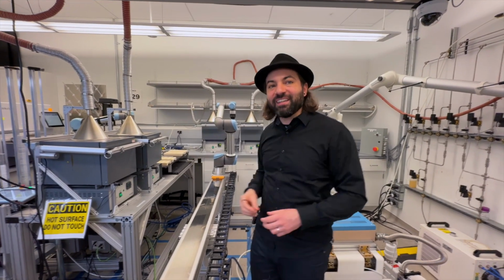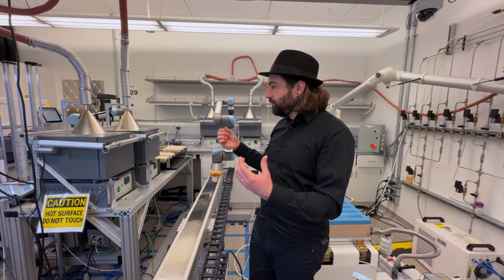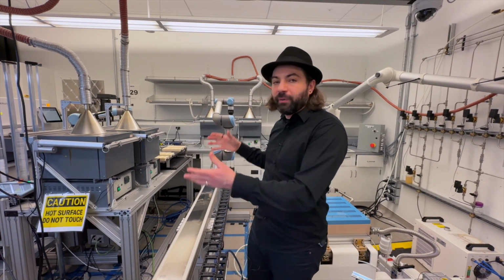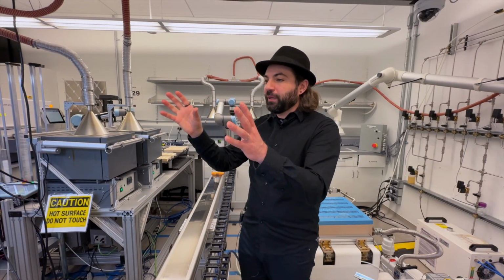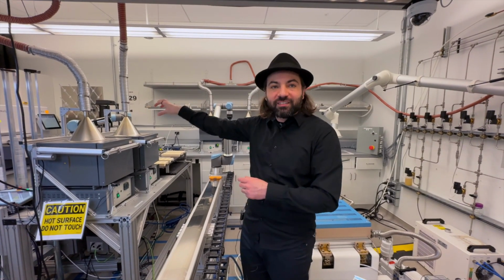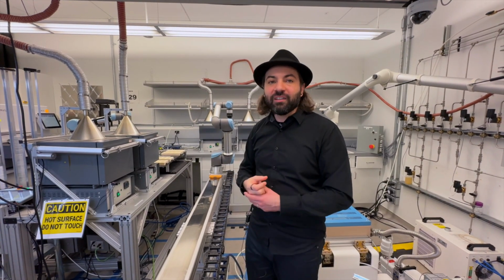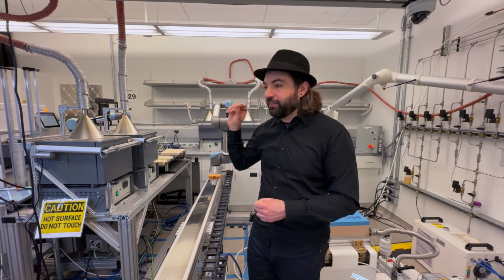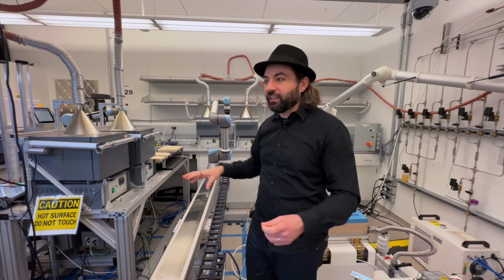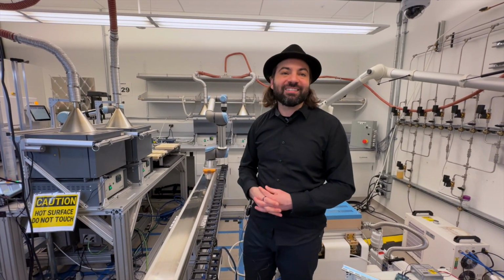That is so smart. It's really cool. So all these tasks happen at the same time, and the processes, of course, are parallel. So I can have new samples being prepared while I'm recovering the powder here to prepare for the analysis, while other ones are being analyzed right now. So it keeps going. We can have people constantly having new experiments inserted, and the lab is going to manage everything, calling us from time to time just to clean some things.